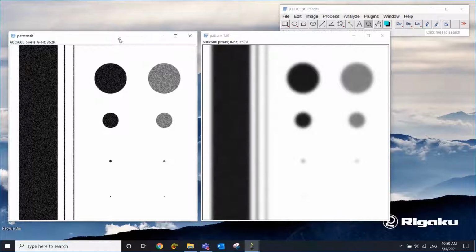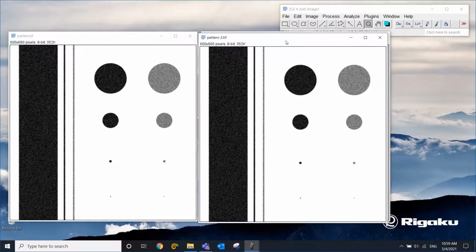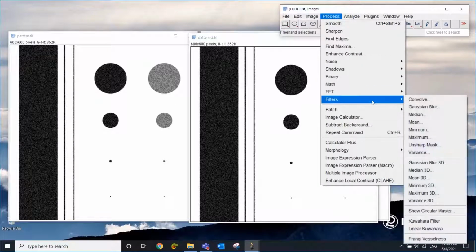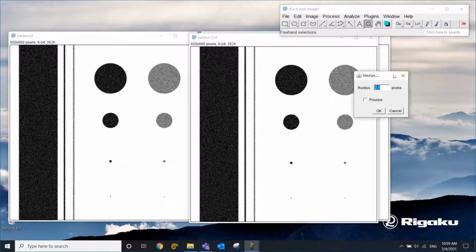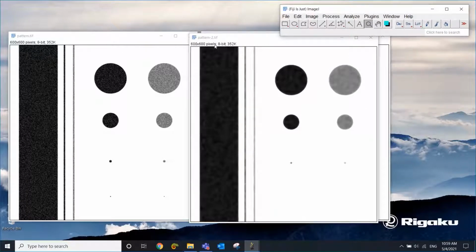So going back to the original, I'm going to duplicate it again. I just did a Control-Shift-D to make another one. And this time, let's choose something else. For example, median filter. So median filter is known to be really good at getting rid of the noise while keeping the edges sharp. So let's check preview, and as we did for Gaussian filter, let's do the same 5 and click apply.